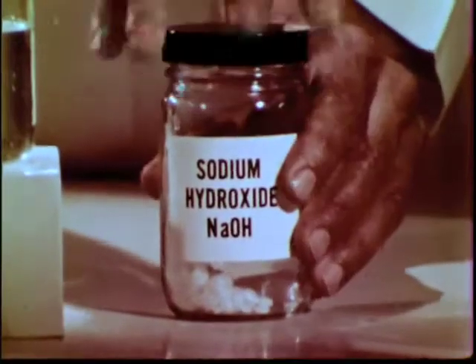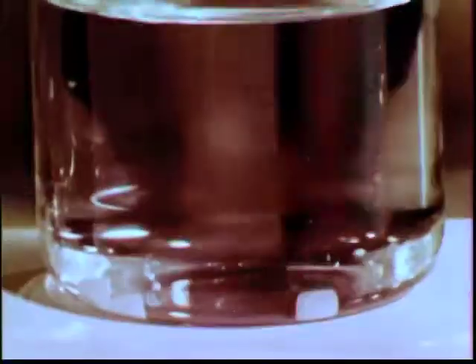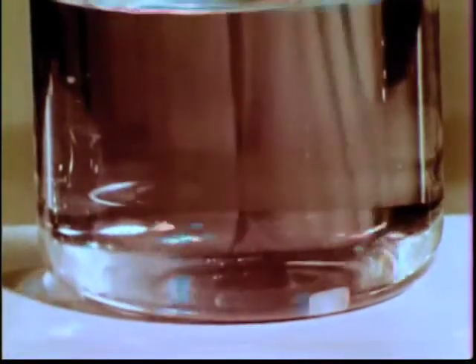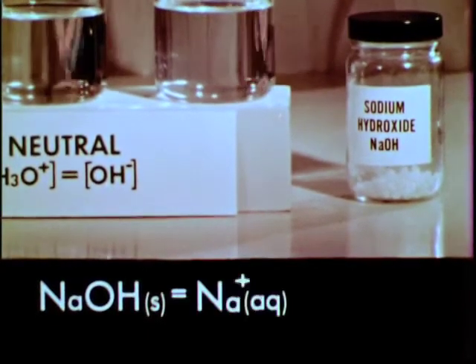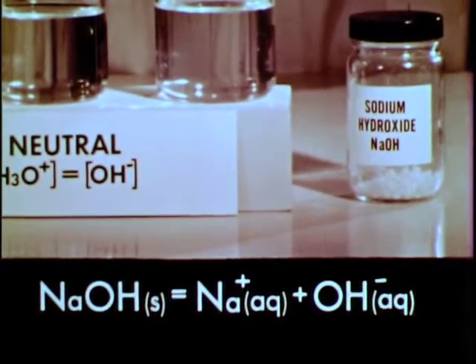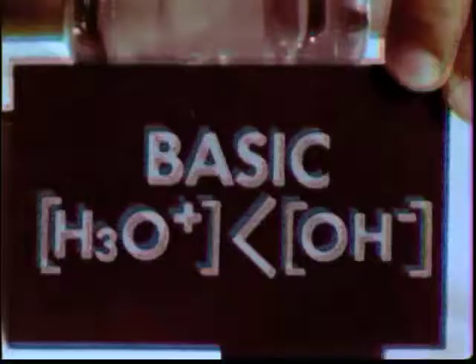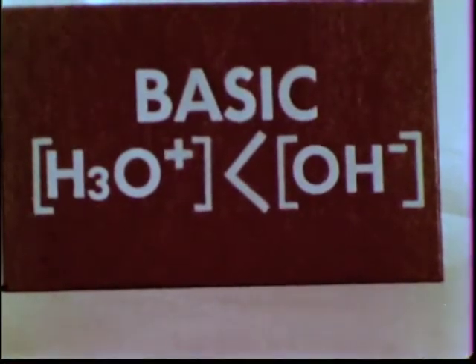Next we'll add solid sodium hydroxide to one of the other beakers of neutral water. The concentration of hydroxide ions increases. The solution becomes basic. Basic solutions have a lesser concentration of hydronium ions than hydroxide ions.